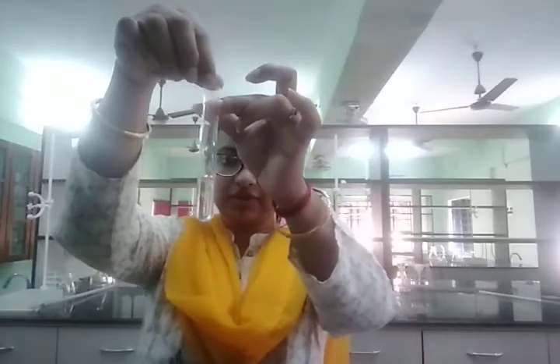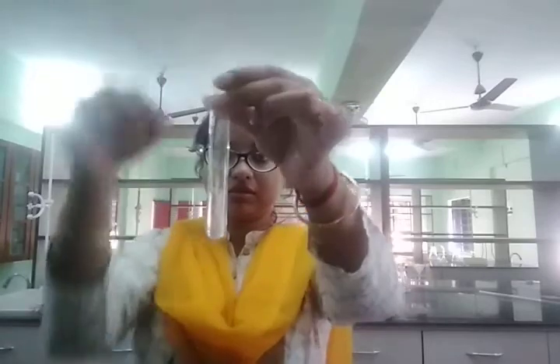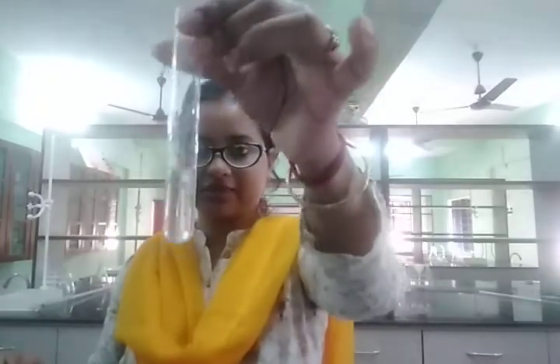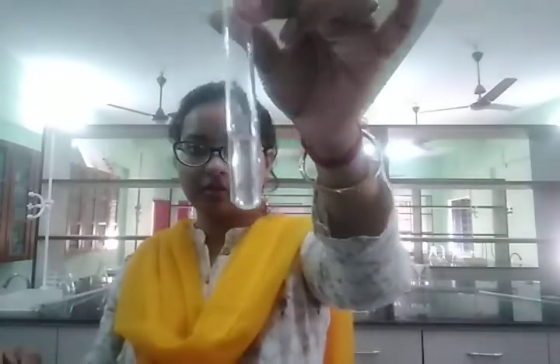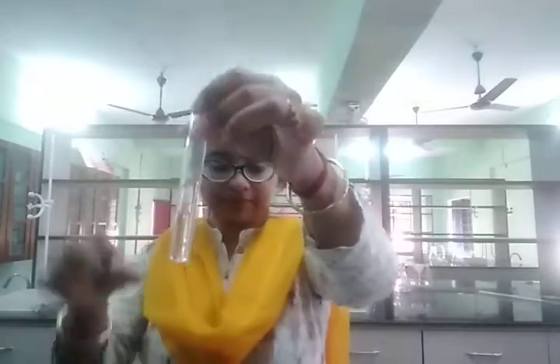Let's see if we get the effervescence or not. See, we are not getting any visible change here.